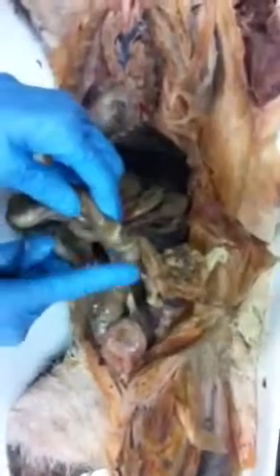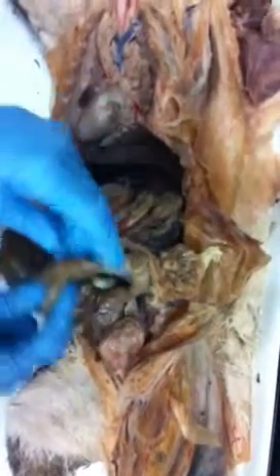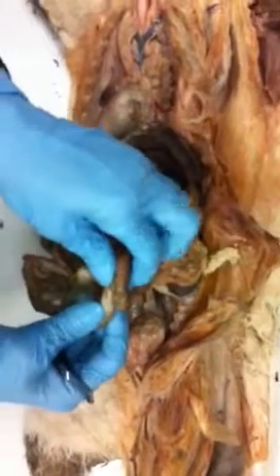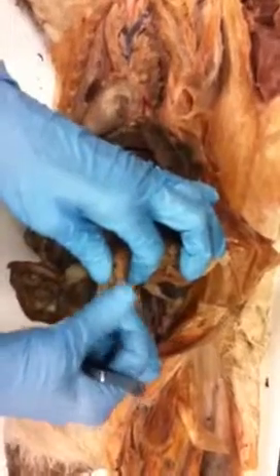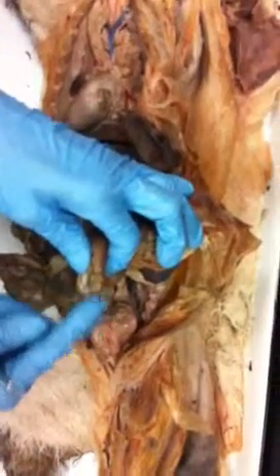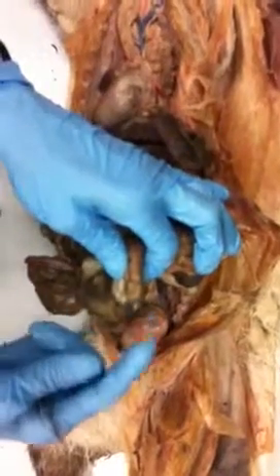Leads to the large intestines, which is all this stuff. There's less of it, but it's larger in diameter. Right where the ileum, the small intestine, meets the large intestines, you have this little blind sac right here. That's called the cecum. If this were human, this would be where our appendix is hanging off of. Okay, cats don't have an appendix; they have a cecum.